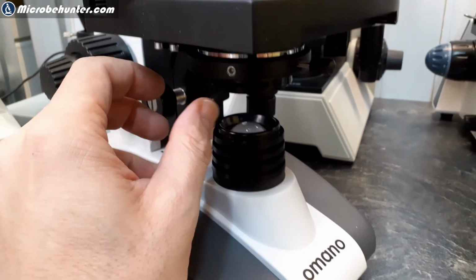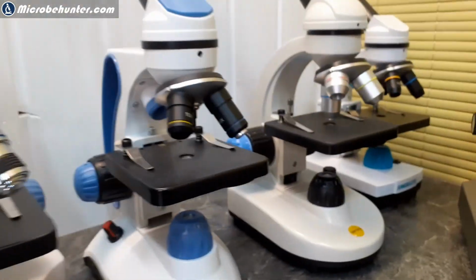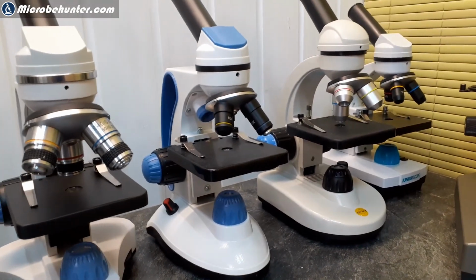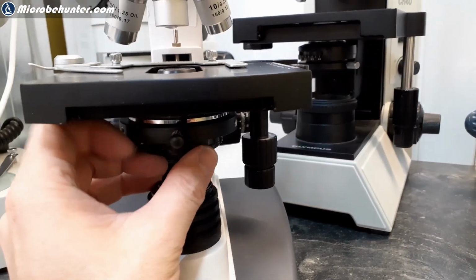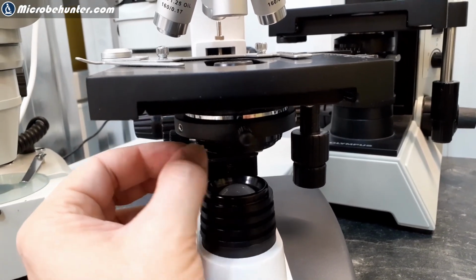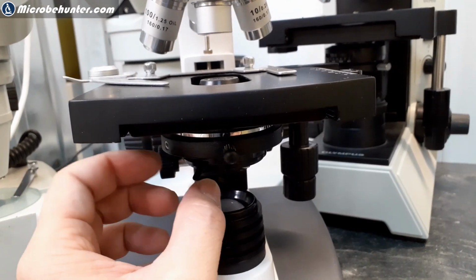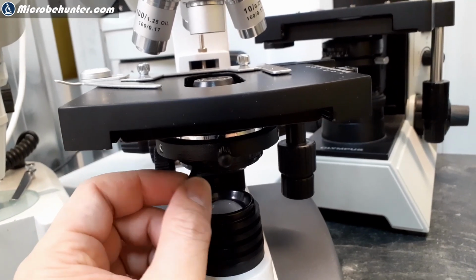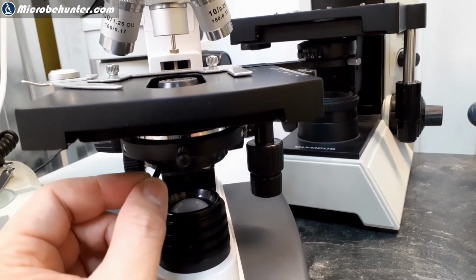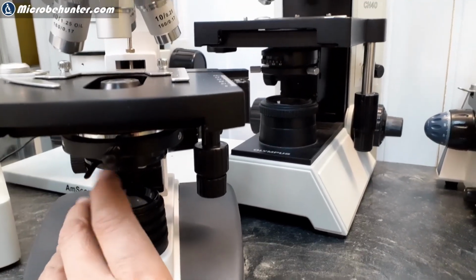This one over here, down here, is called the condenser. And those introductory microscopes over there don't have that for cost reasons. But the condenser is actually quite important because it allows you to control contrast and depth of field. There is a lever over here, and it also bundles the light, so you also get a brighter image this way. For the more difficult to view specimens like bacteria, it's absolutely essential, I think. But again, children might be a little bit overwhelmed with all of those features that those microscopes have.